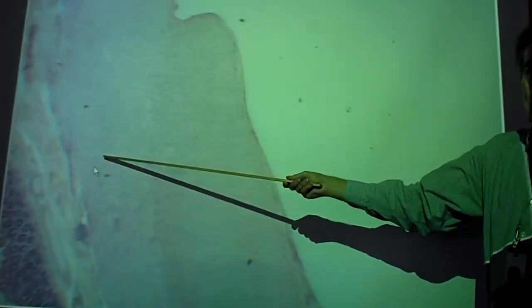Inner circular smooth muscle around the entire wall, the longitudinal layer is not intact. It's just these parallel longitudinal bands, teniae coli. Because they're partially contracted, that's what causes the pouches or the pucker shape to the wall, which we call haustra. Very characteristic of the human large intestine.